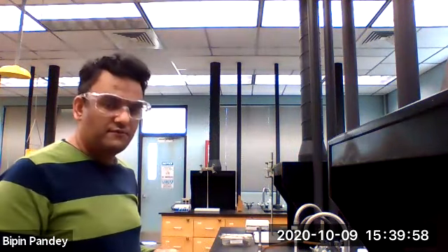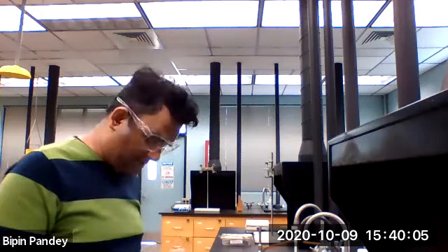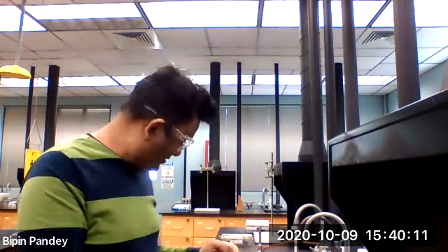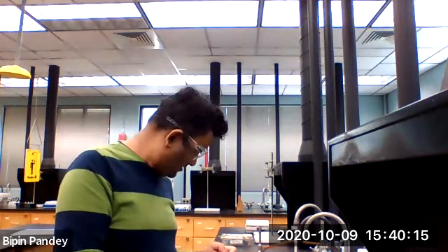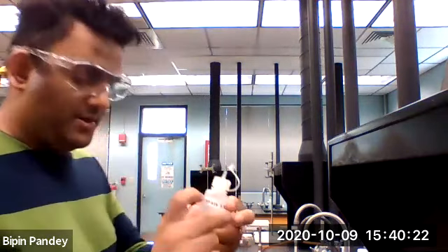Seven is a repeat of number 3, where we are reacting sodium sulfate and barium nitrate. So we have sodium sulfate, we have barium nitrate.